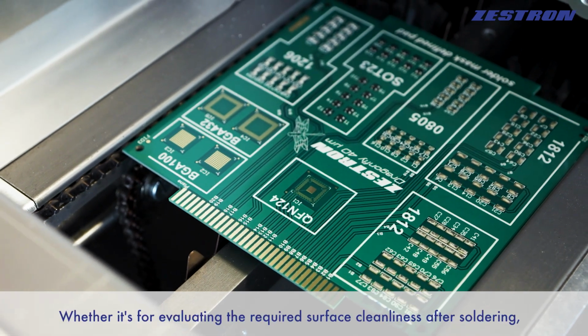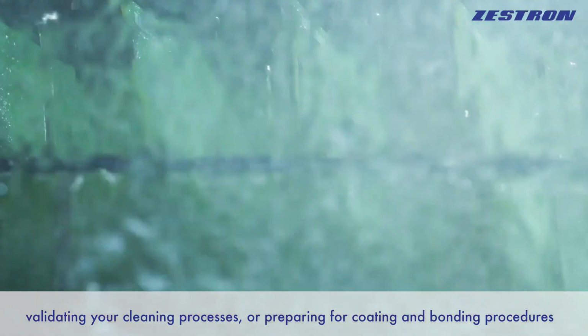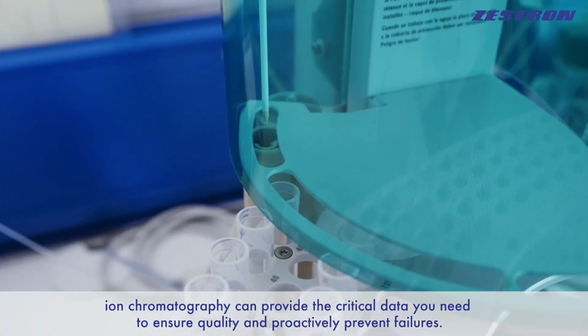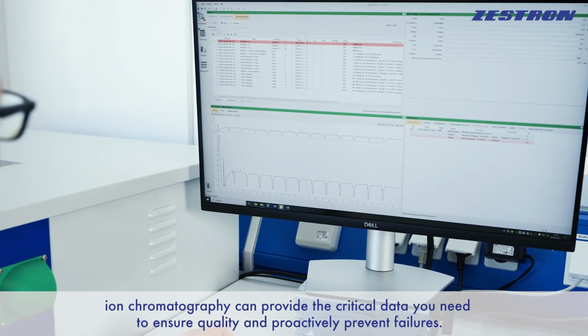Whether it's for evaluating the required surface cleanliness after soldering, validating your cleaning processes, or preparing for coating and bonding procedures, ion chromatography can provide the critical data you need to ensure quality and proactively prevent failures.